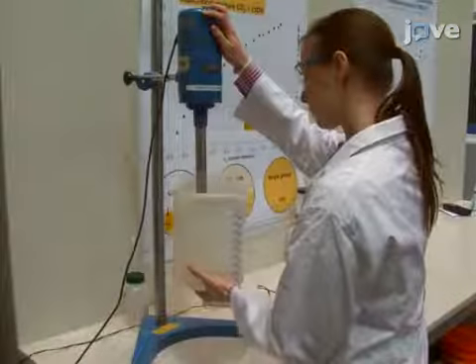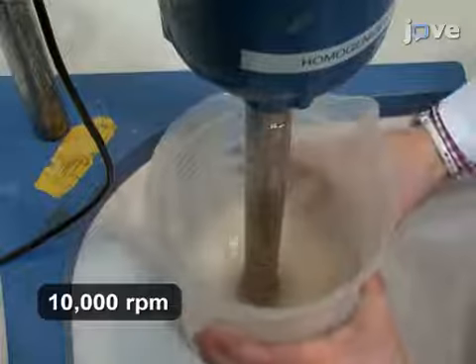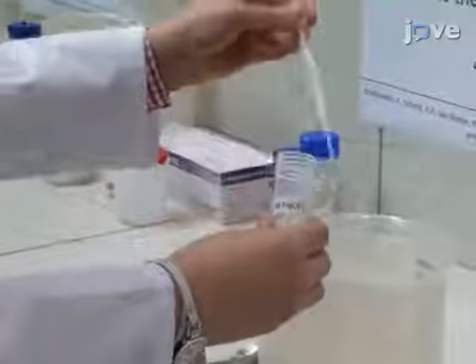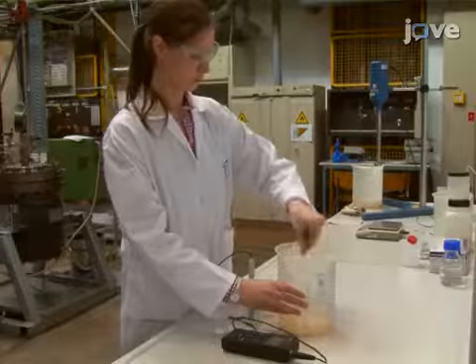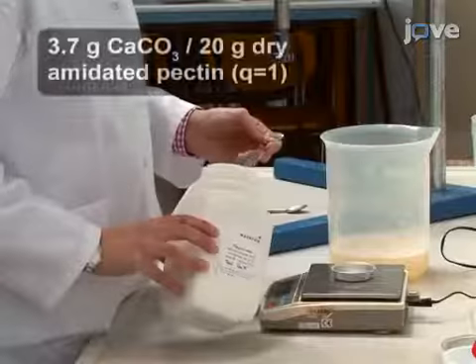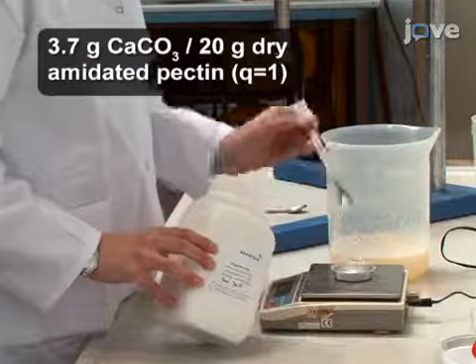Homogenize a 2% pectin in water solution at high speed for 2 minutes to make a viscous solution. Then, check the pH. If it is lower than 6.5, titrate with 0.5 molar sodium hydroxide to neutralize the solution. Next, weigh out and mix in the calcium carbonate.